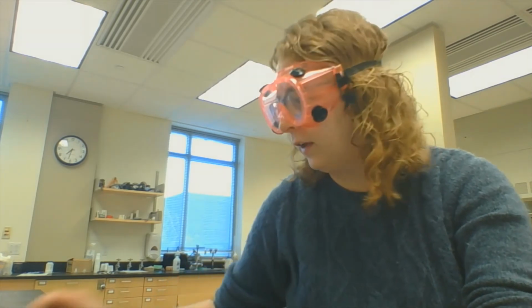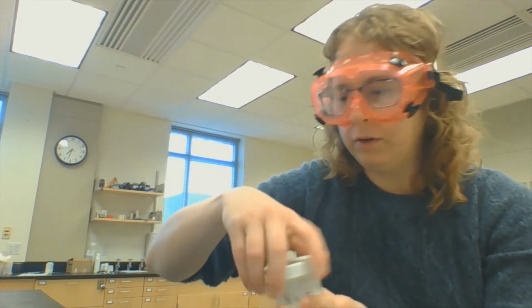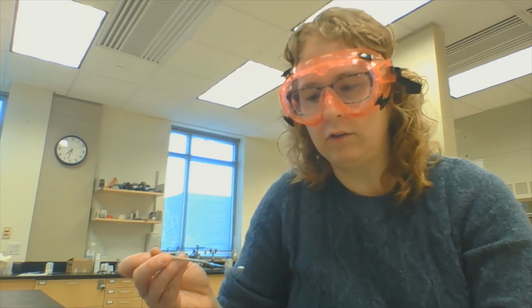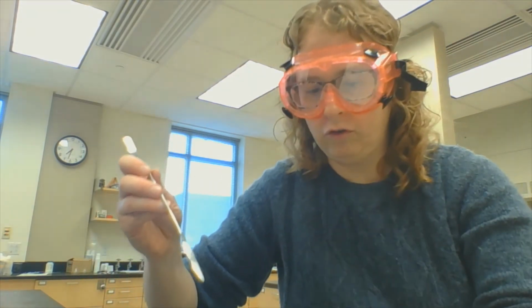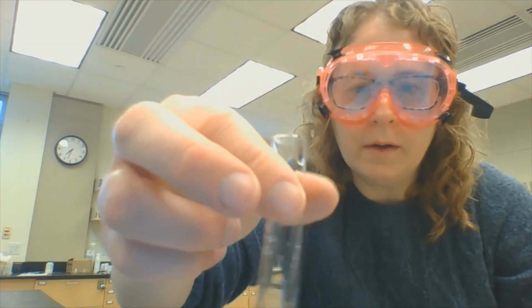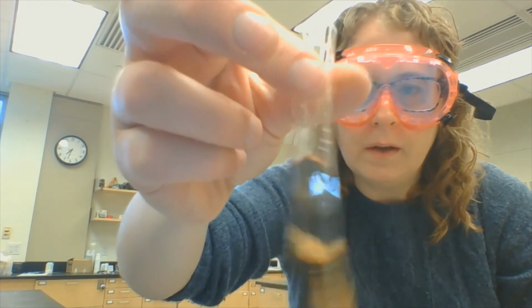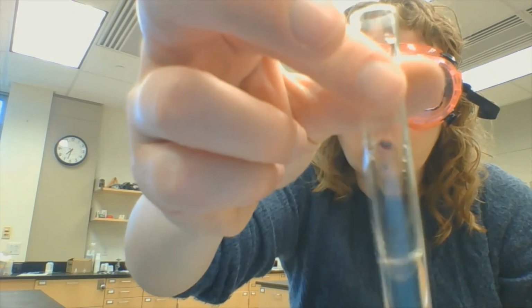Let's see what happens when we take away a reactant. In this last test tube, I have a substance called sodium hydrogen phosphate. What sodium hydrogen phosphate does is it reacts with the iron and takes it away from the solution. I'm just going to take a little spatula tip full of the white powder, and I'm going to spoon it into my solution. And I spooned it into the wrong test tube, so hang on. I'm going to spoon it into the original test tube, and I'm going to mix it up. Just shake it to mix. You can kind of see at the bottom where it's settled. And there we go, much, much better.